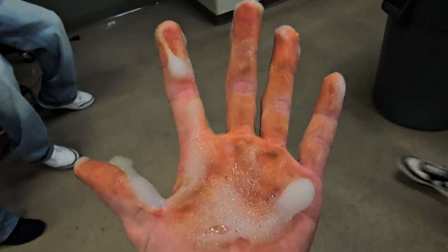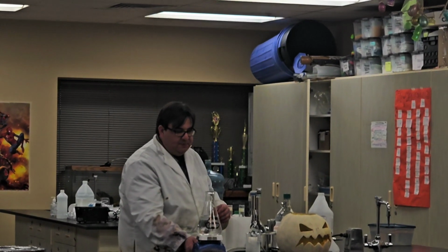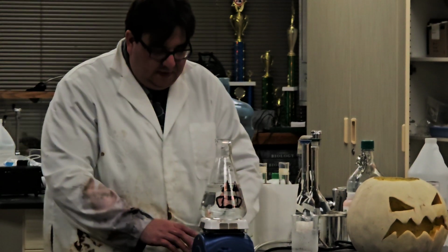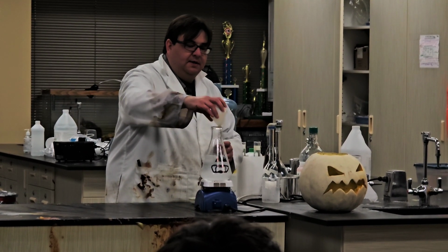Elephant's toothpaste, fire. We're gonna have a little ghost pumpkin using some science. So get him spinning, and he can just sit here and watch you all. We're gonna add things to get him going.